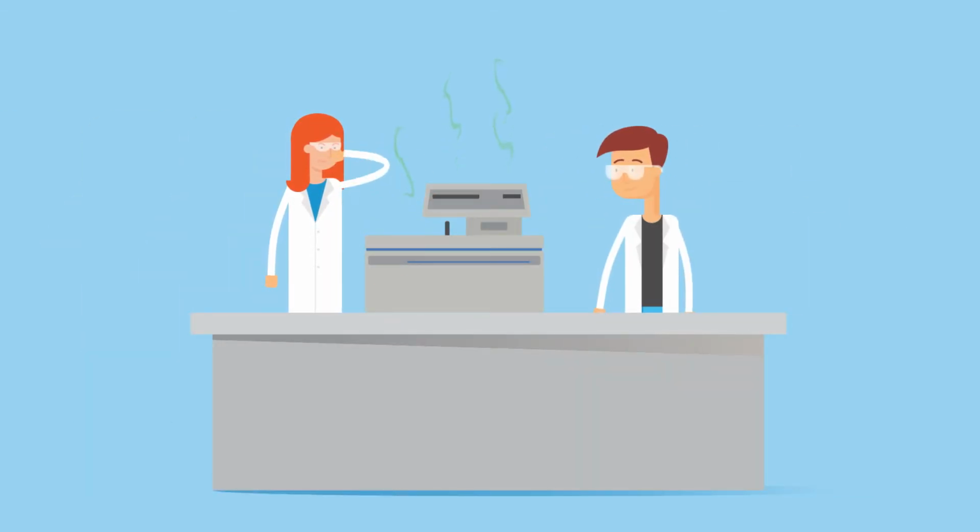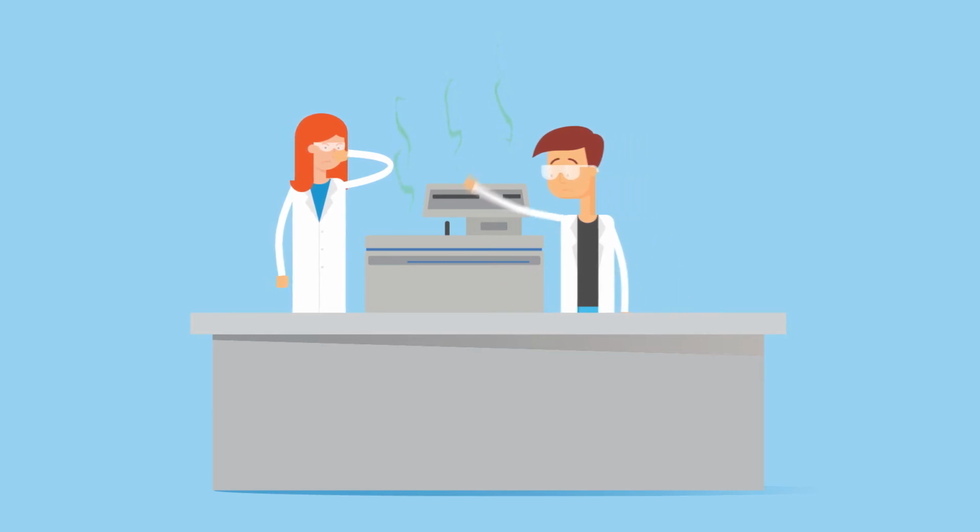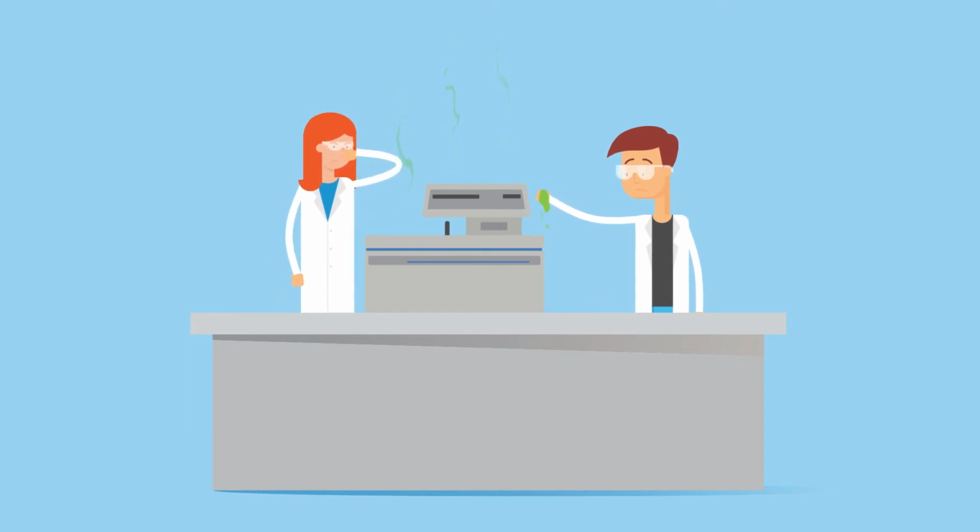Another warning sign that your centrifuge is at risk is the presence of unexplained substances or odors. This may appear as contamination or oily residue on the floor of your centrifuge that can't easily be explained or removed. Also, a buildup of black dust under older centrifuges may mean the carbon brushes need replacing and that the motor should be cleaned and serviced.